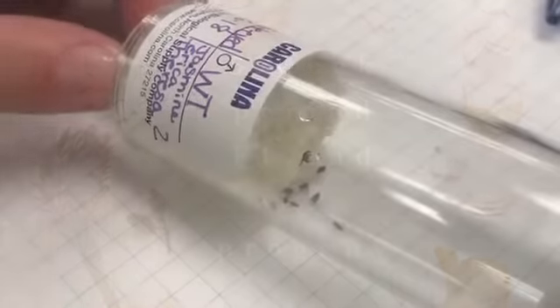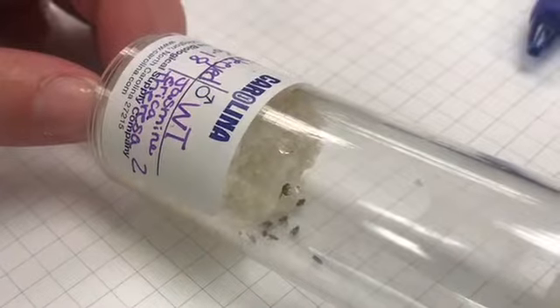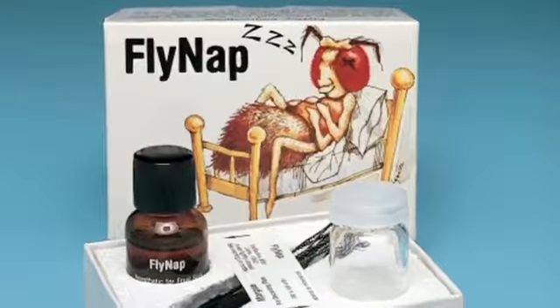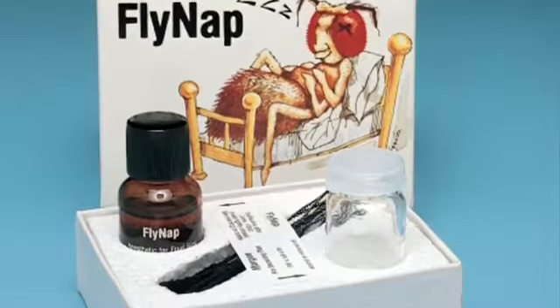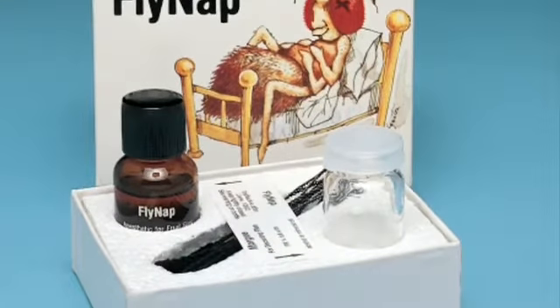To begin, the parental flies were placed into vials with a media to ensure that the flies were able to survive and reproduce efficiently. After a progeny was produced and were in their larvae state, the parental flies were removed from the vial using fly nap, which is a safe way to anesthetize the flies for evaluation, and the larvae were left to hatch. After hatching, the progeny flies were observed under a microscope to determine the sex and eye color.